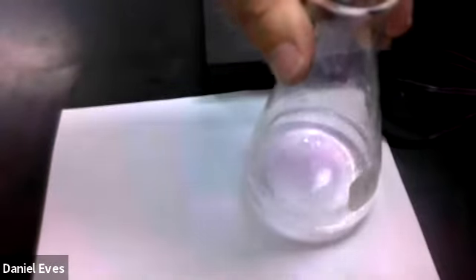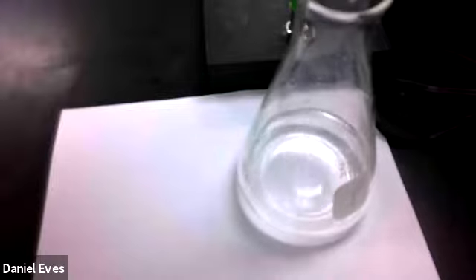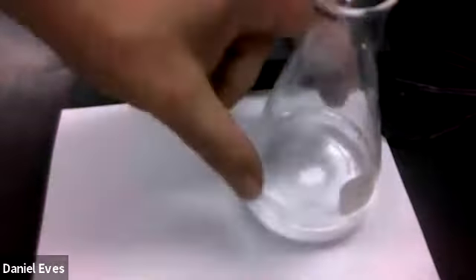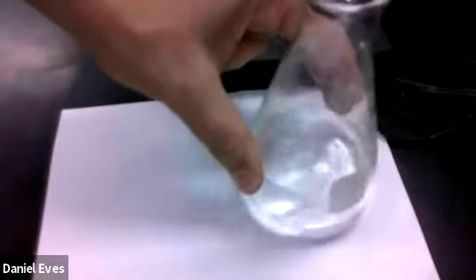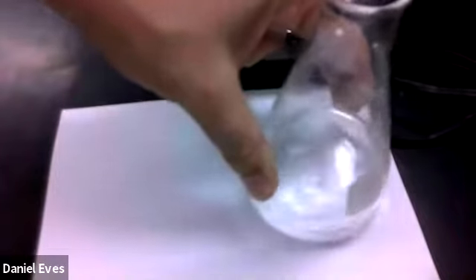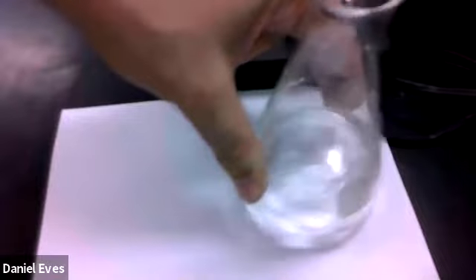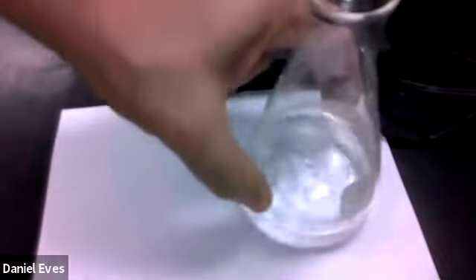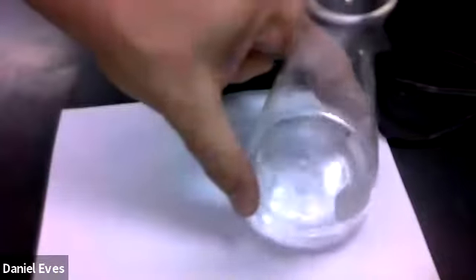So I'm going to slow this down a little bit, and you can still see a little bit of pink, but it's gone away. So I'm going to add a little bit more, a little bit slower this time. Okay, I'm going to look for that pink coloring. And when the pink color persists, then I know I need to stop and make sure that I have exhausted all of the acid in the form of potassium hydrogen phthalate as I do this. So I'm going to let it sit and see if we can get it to go back to pink. Looking, and it's some pink, still pink.